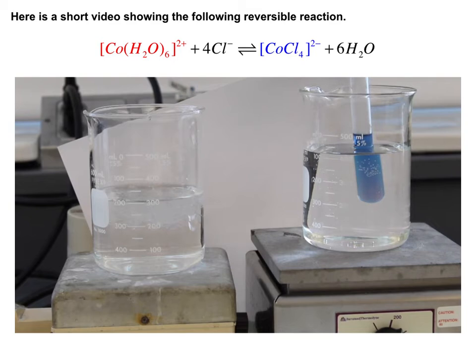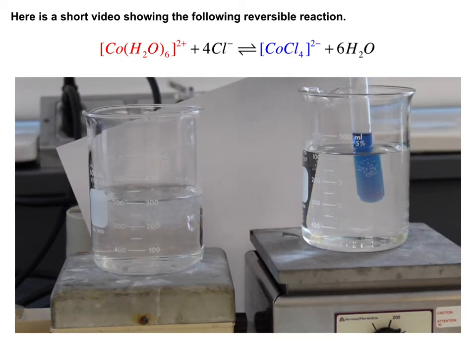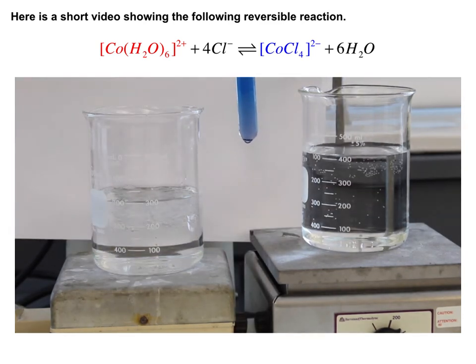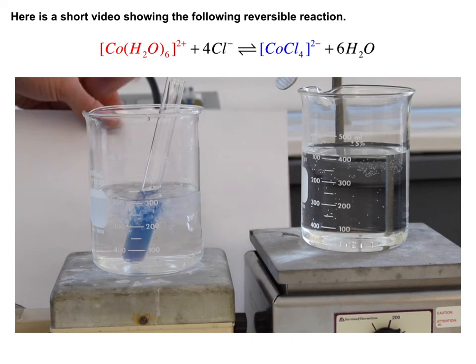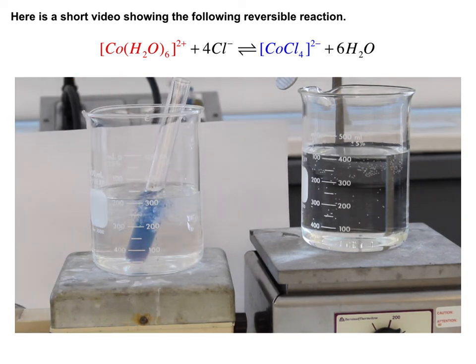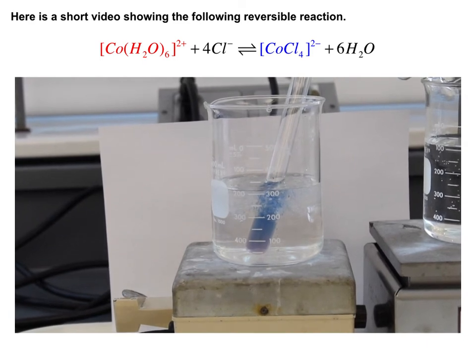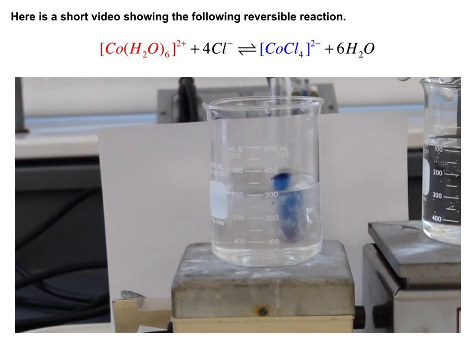And so what I hope you are observing is the formation of that blue color returning. And so when we added heat, what happened? We shifted this reaction to the product side. We converted to the cobalt chloride. If we take that same test tube out and put it now in our ice water bath, we can ask ourselves, what's going to happen?